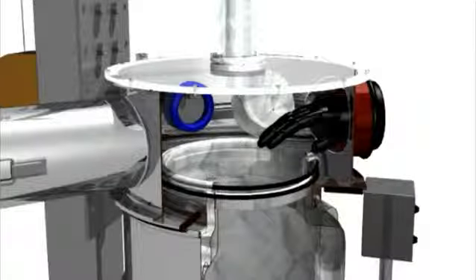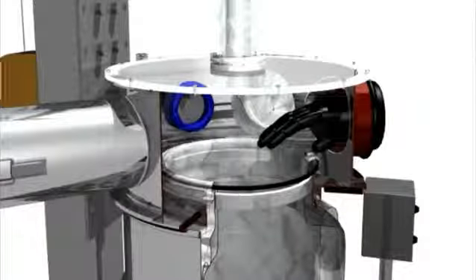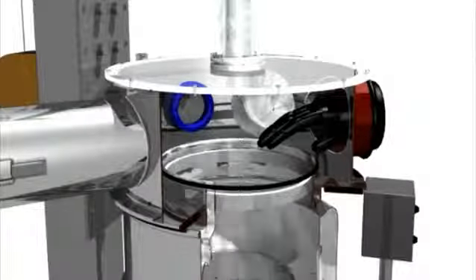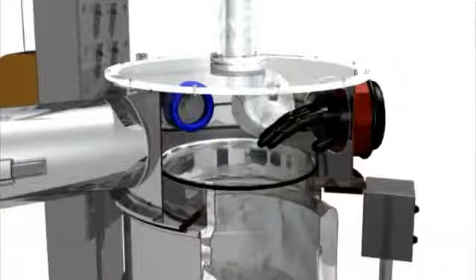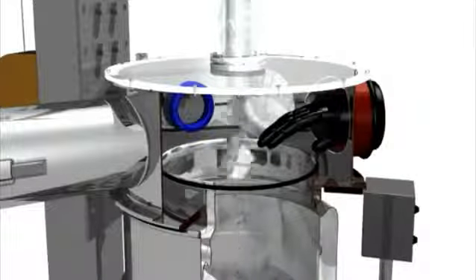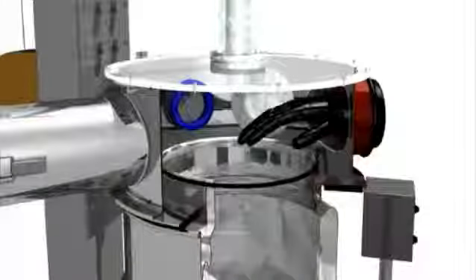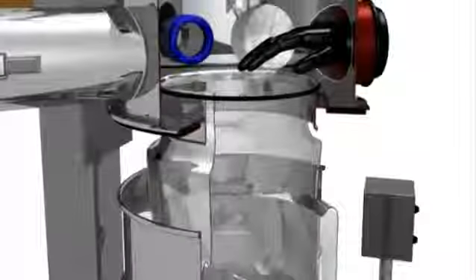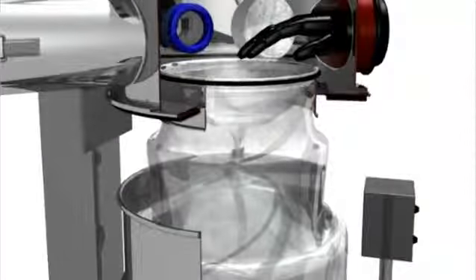The inner liner connection O-ring is removed, and the O-ring and push ring with the bag are discarded into the primary bag. The DCS is then raised using the integrated safety buttons with the outer liner still attached.